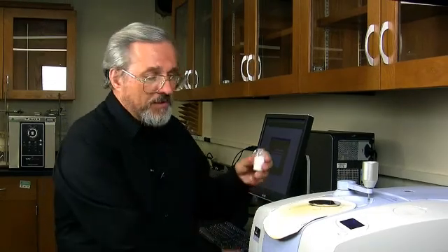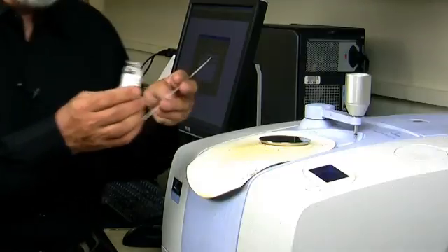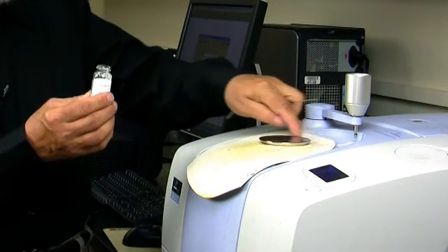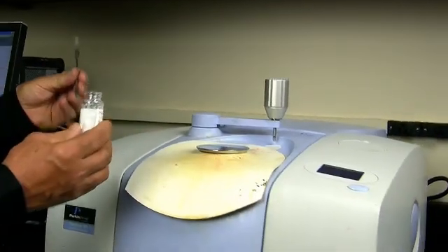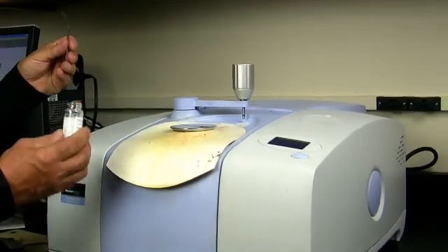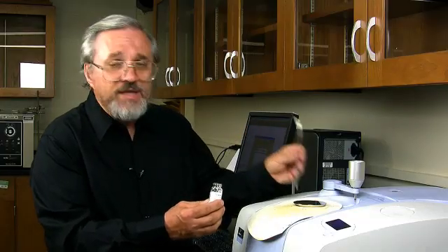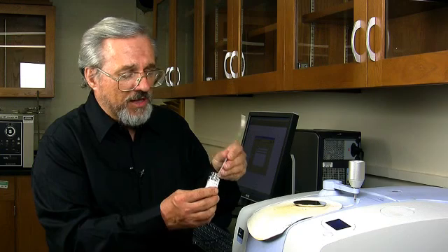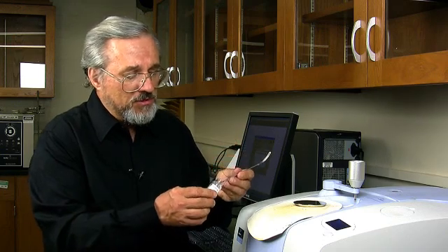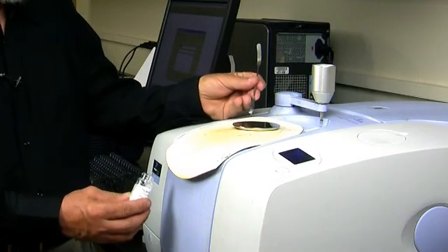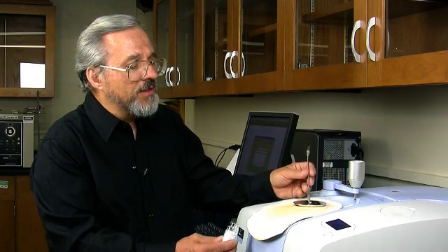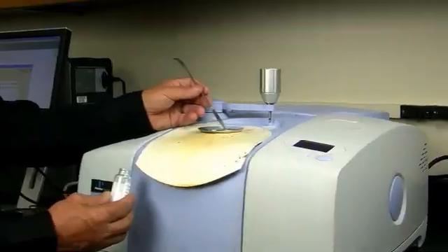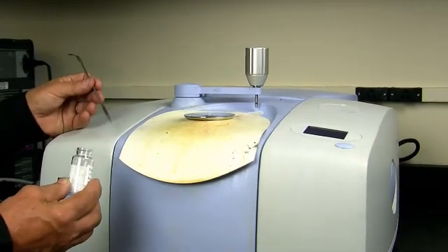The way we go about this is the following. We have a metal disc here with a small diamond in the center of it. We're going to take a small amount of this solid and put it directly on that diamond position. I'll just take a little bit out and put it on the center. You've got to put it right on the center, just like that.